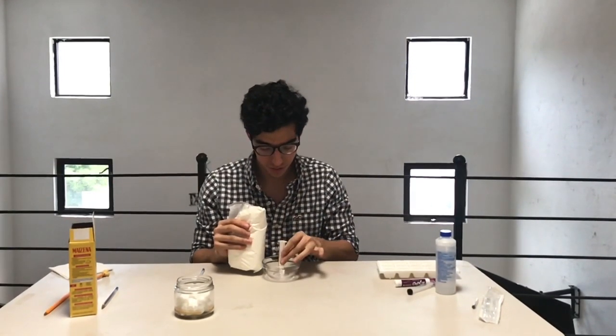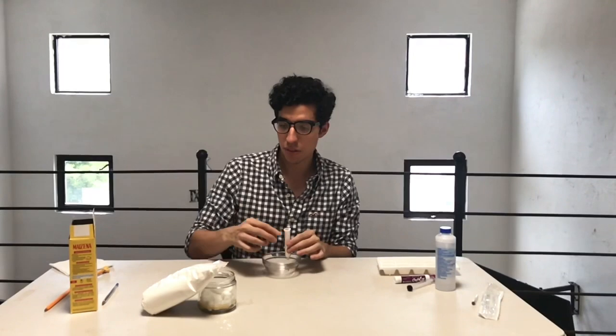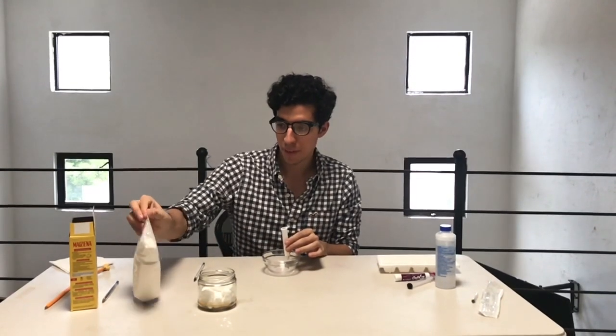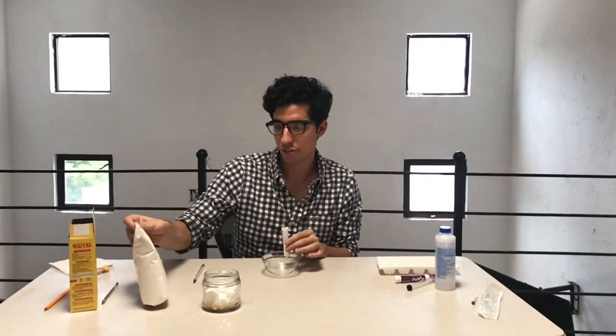We will not fill it too much, because it can make our extraction last too long, depending on the amount of stationary phase that we use.